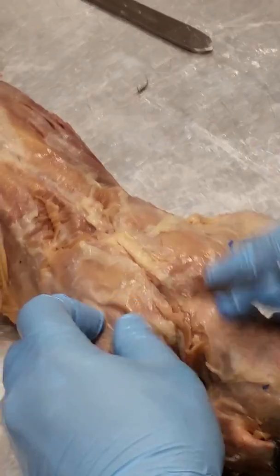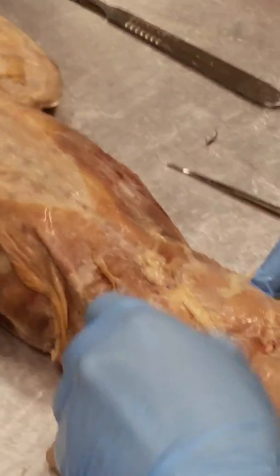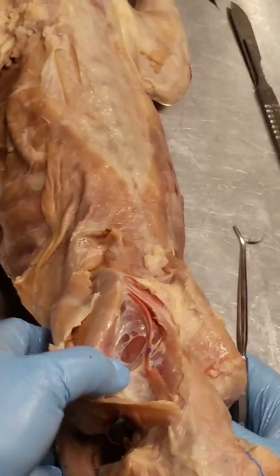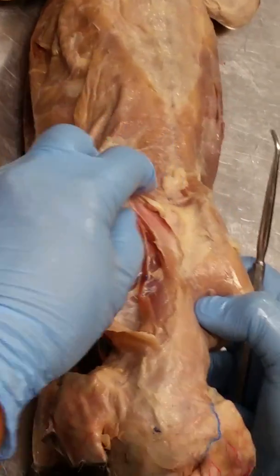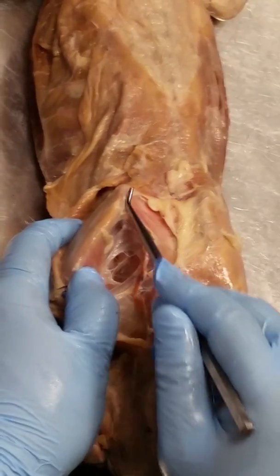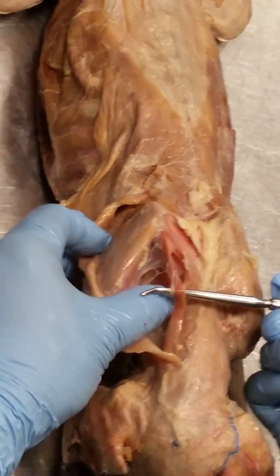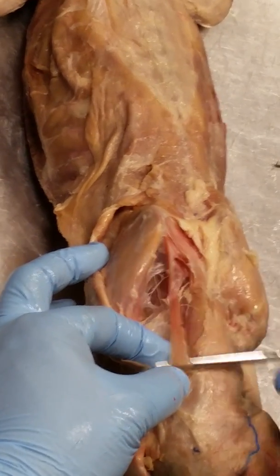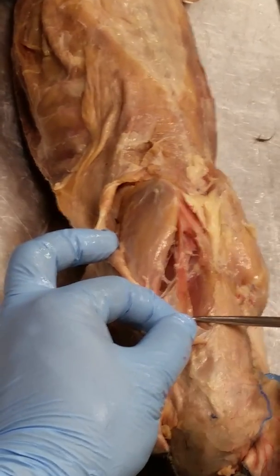what I did was I cut into all of the trapezius muscles. And I'm going to reflect them back. All right? And what I see is the entire shoulder blade here and some muscles that are connecting the shoulder blade to the vertebral column. So these muscles right here, those are called the rhomboideus muscles. And then there's one that extends all the way up to the head, or the cap, rhomboideus capitis. The big neck muscle underneath all of this is called the splenius.